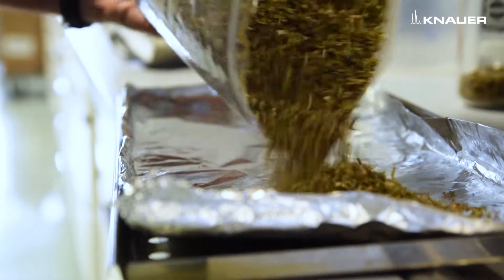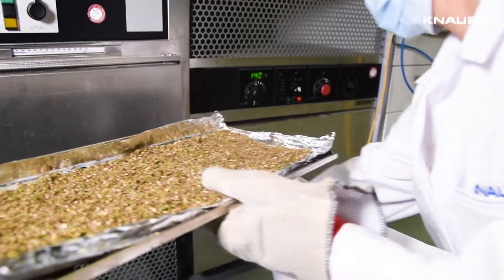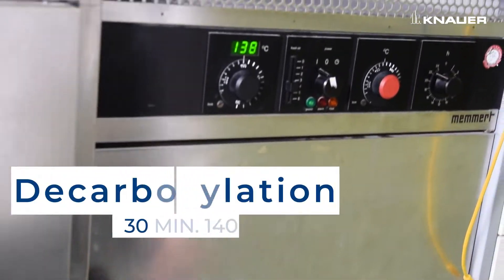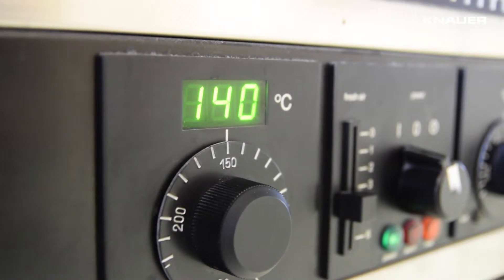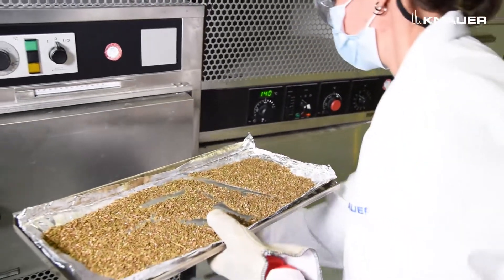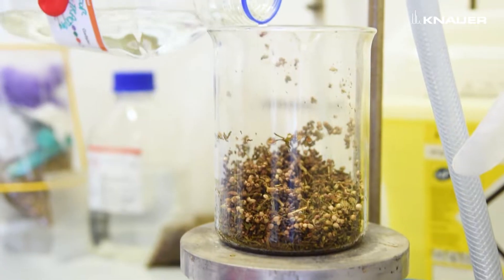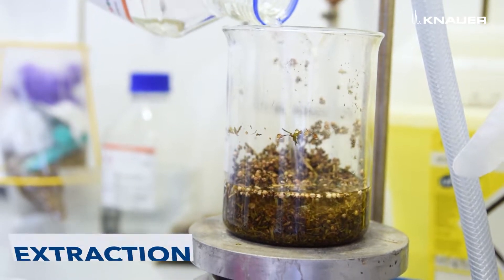Cannabinoids are produced in acid form from the metabolism of the plant. For this reason, a decarboxylation step is required in order to have neutral cannabinoids in the sample. The decarboxylation is achieved after 30 minutes at 140 degrees.